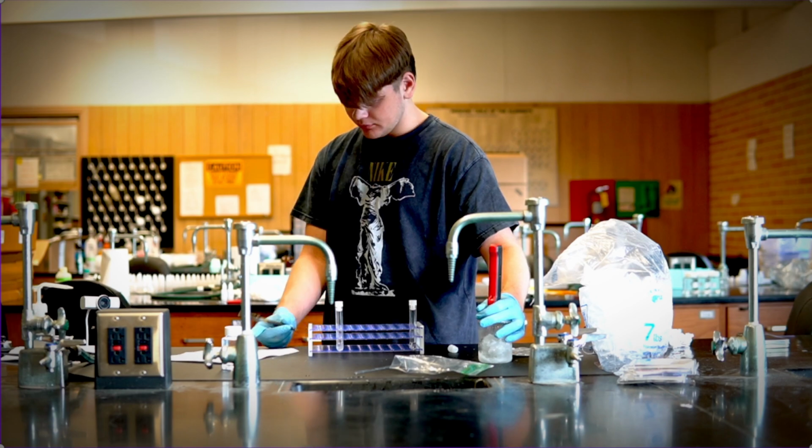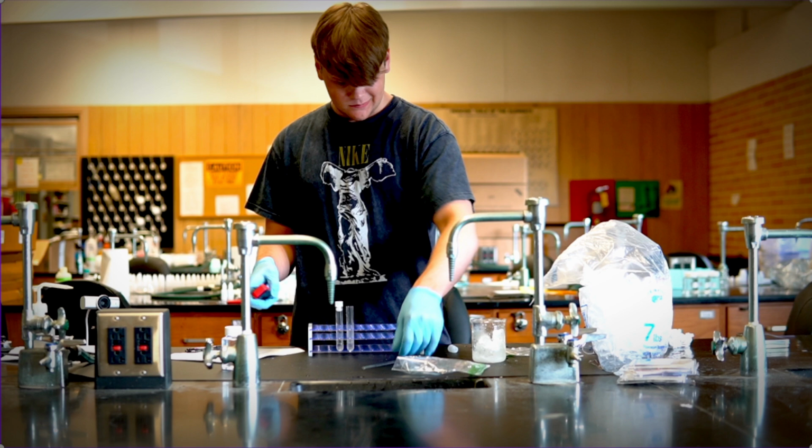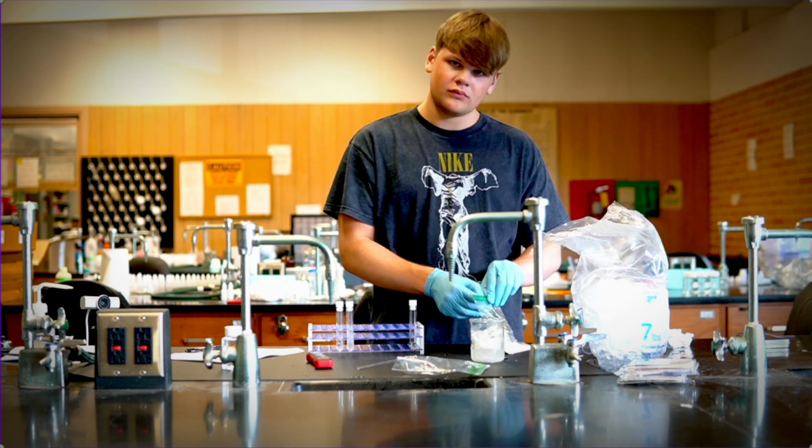Check whether or not the water has frozen. And then if it froze, write down the temperature and time at which it froze, and then stop, right? After it freezes, stop. You don't have to go all the way to 5 minutes. And then again, write down the temperature after, right? And then after you're done with that, guess what, you do it a third time, right? And you notice that we're using the three tubes at three different concentrations.